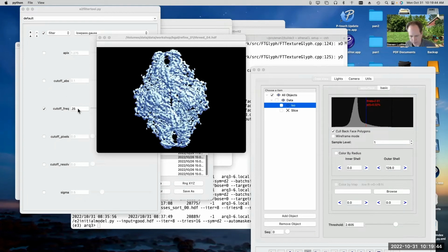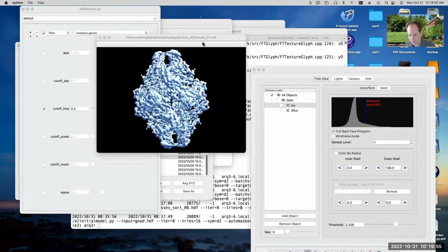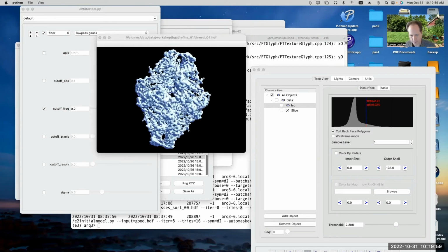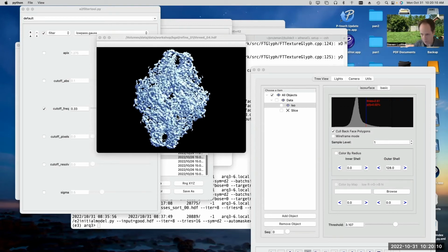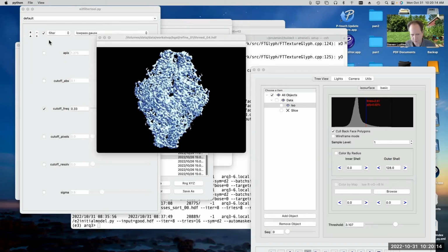Anyway, you could play with that filter threshold a little bit. You could filter it to say, maybe 0.2. So that's a 5 angstrom low pass filter, and see what it would look like. Or we could filter it less. Now, if we filter it to beyond the resolution that we've achieved, you'll notice it's still doing a filter. It's still getting rid of some of the noise.